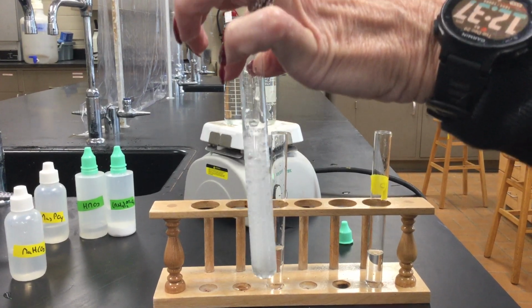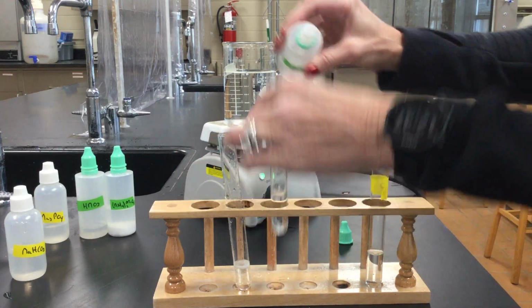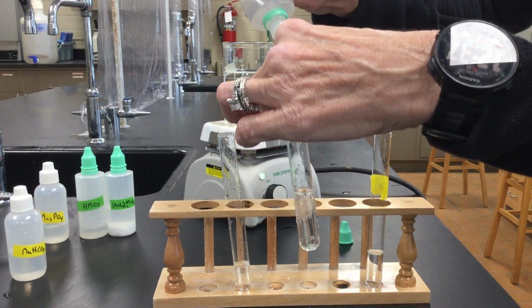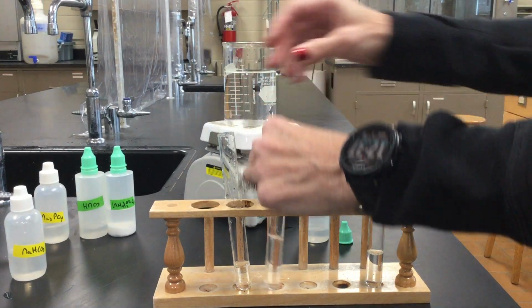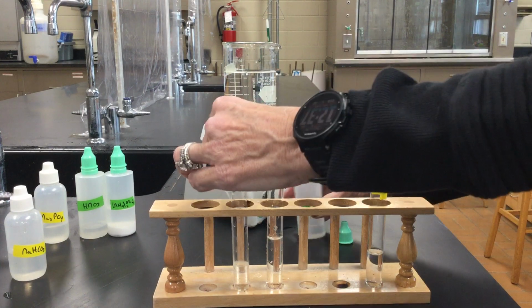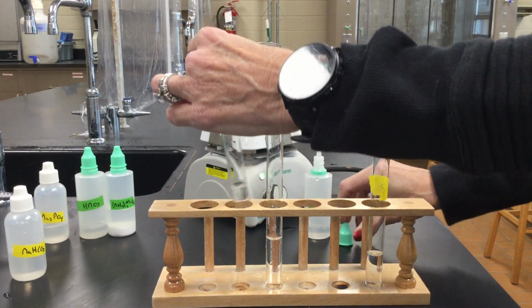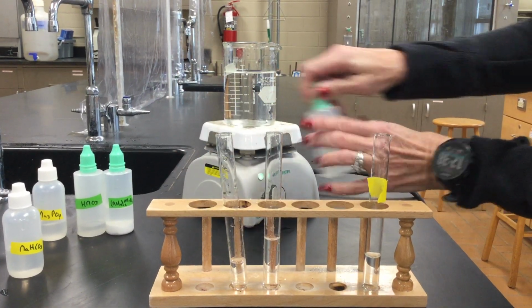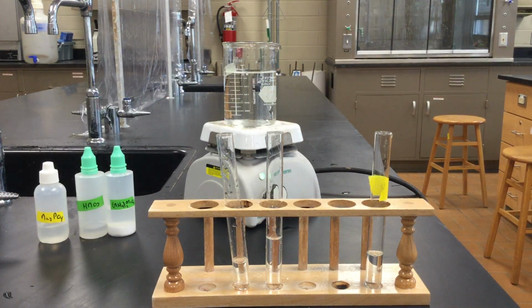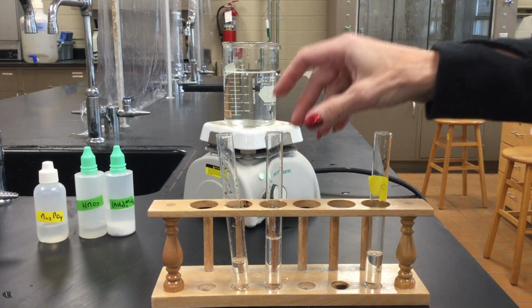So if you notice, we've got a lot of bubbling going on. And then not really much going on with our unknown. So again, our known, the one that does have the sodium bicarbonate, it's all used up. Did some bubbling. That means it formed a gas when we see the bubbles. When we see those bubbles, that means the chemical reaction that took place between the hydrochloric acid and the sodium bicarbonate created a gas, and that's all those bubbles.